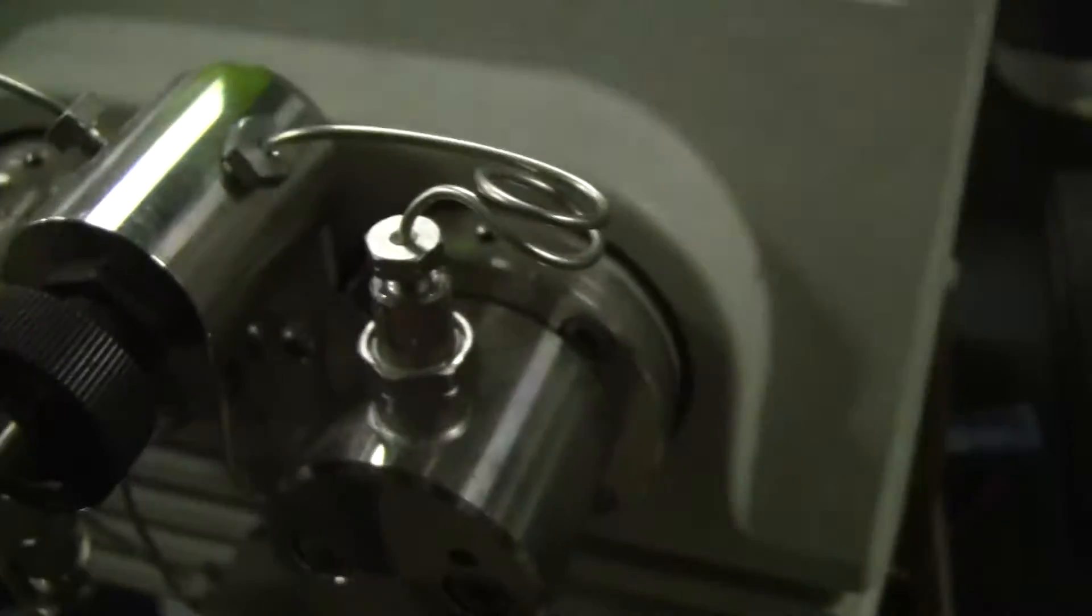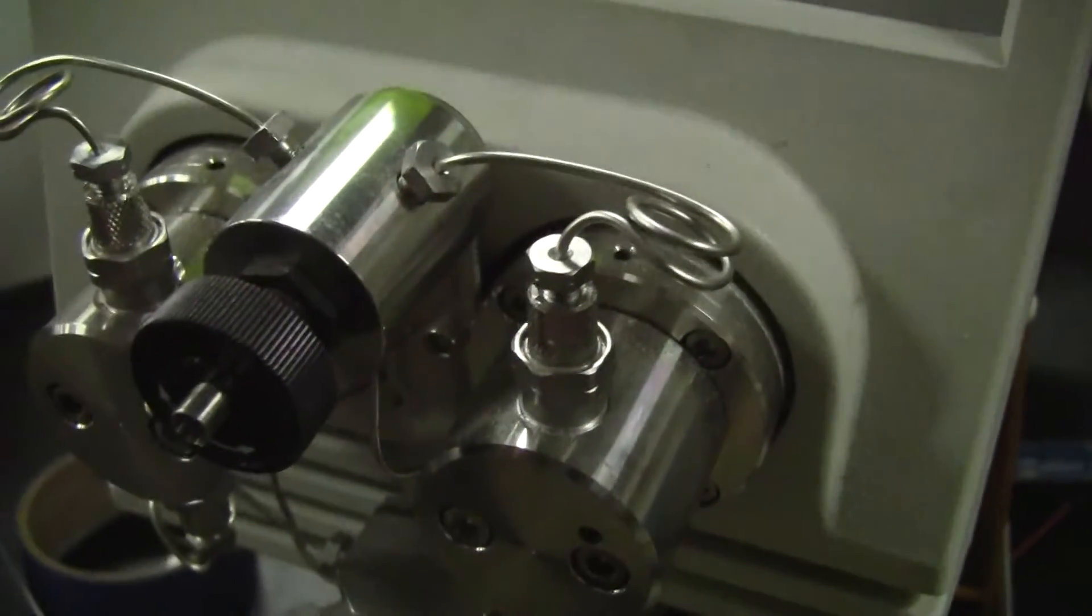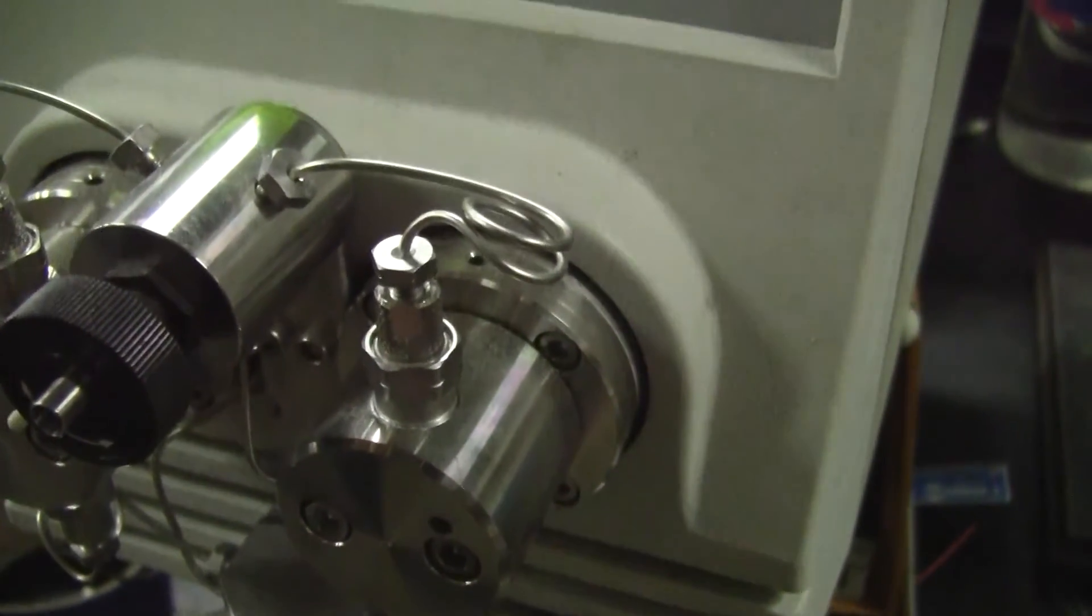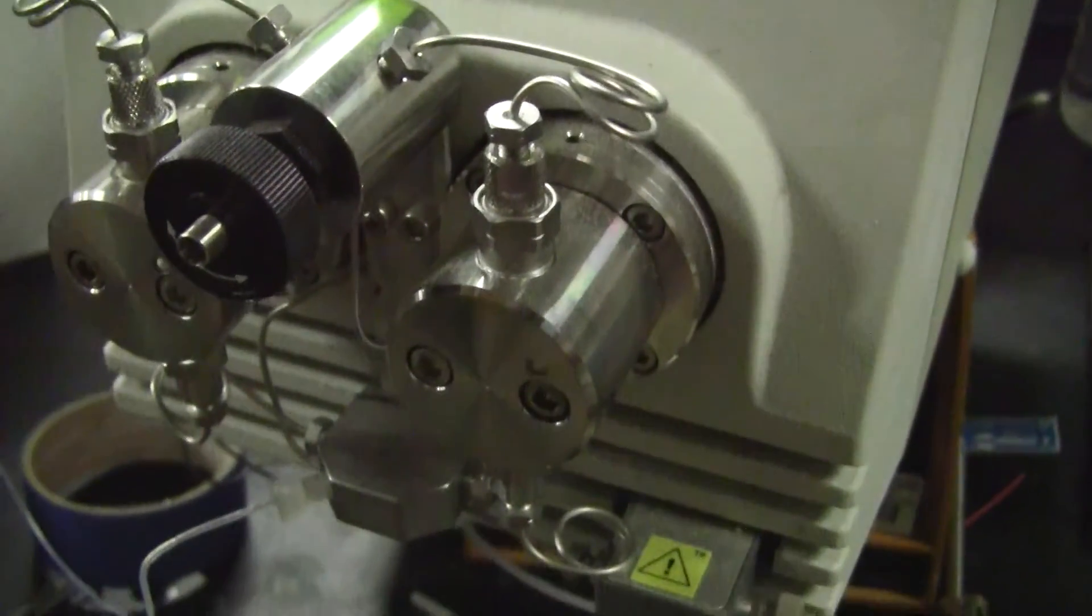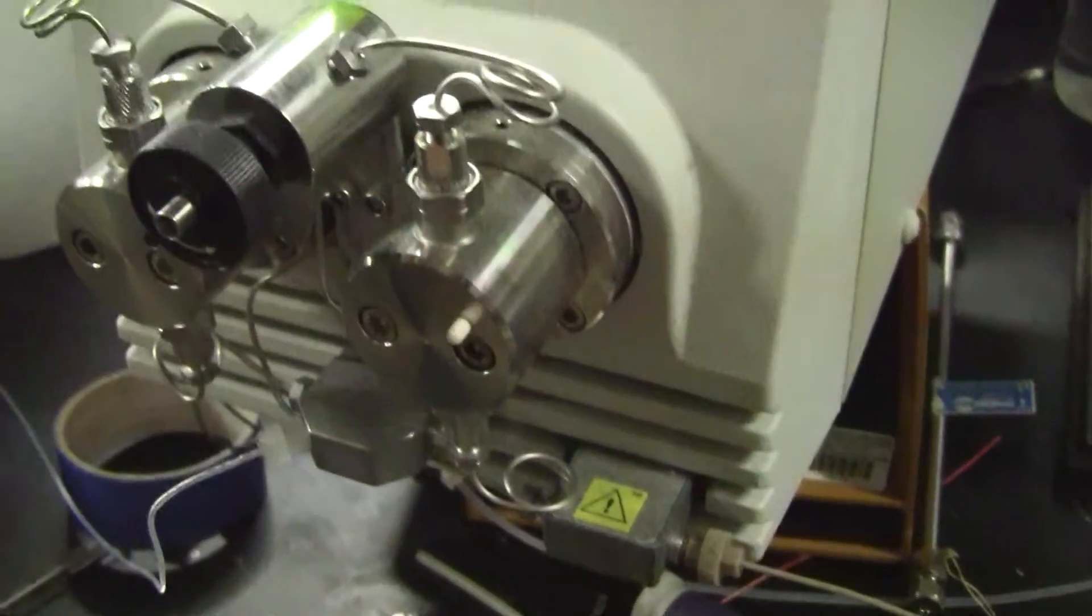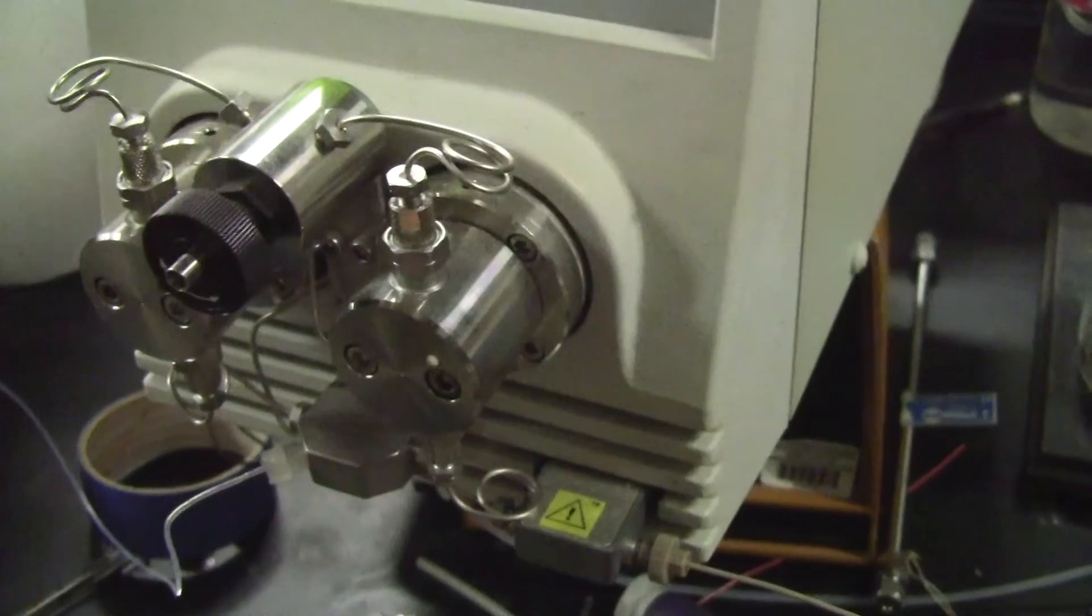Nice pressure, no leaks. Diana, if you can give me a 10. Yes, please. Thank you. Pump sounds good.